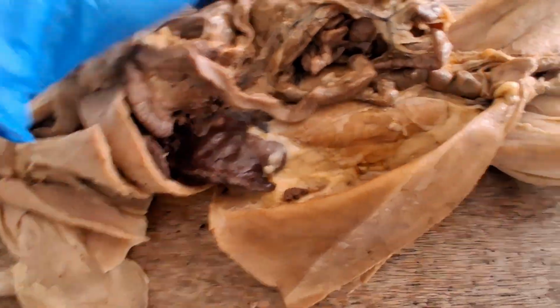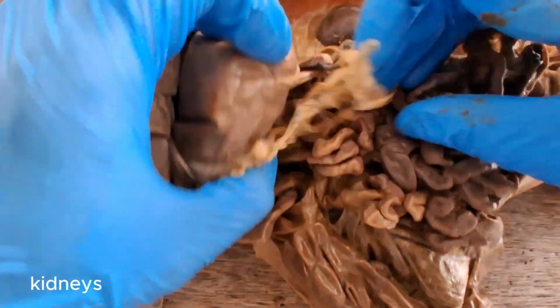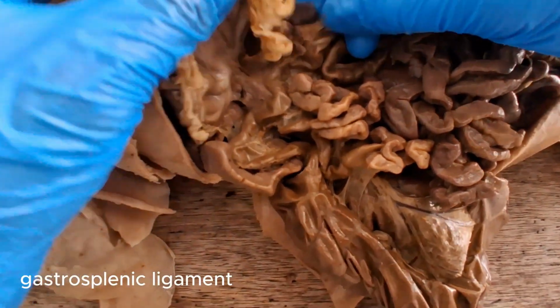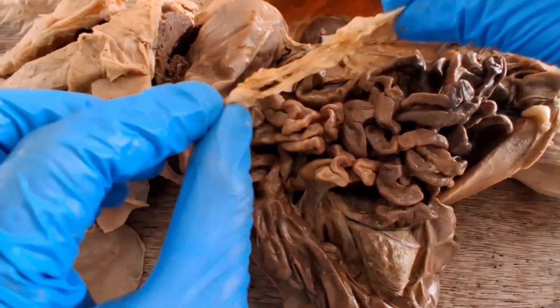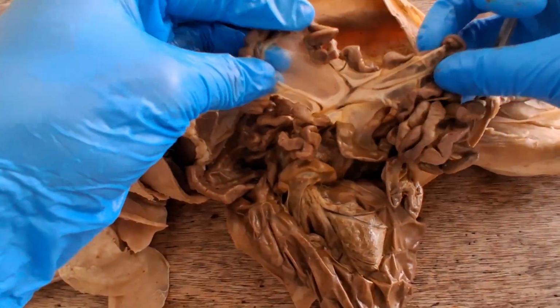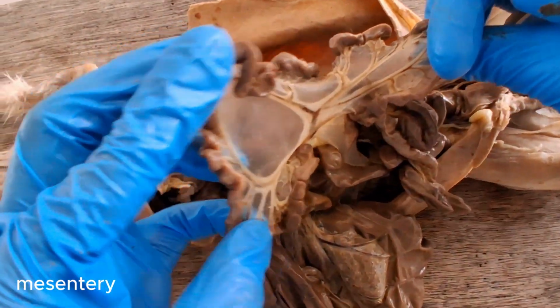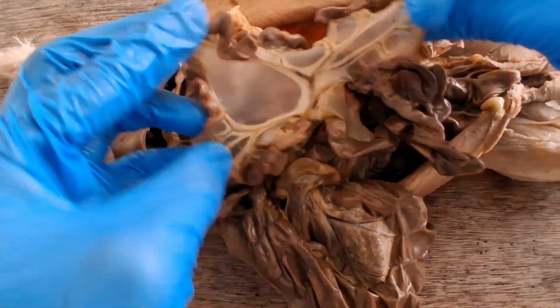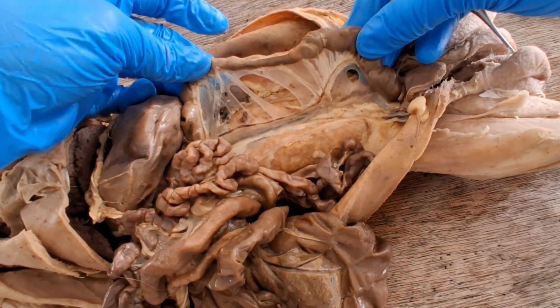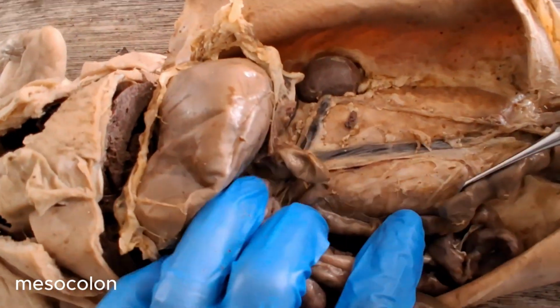This one is the right kidney. That's the left kidney. This mesentery in between the spleen and the stomach is the gastrosplenic ligament. This one is the greater omentum. This one supporting the jejunum would be the mesentery proper. Lots of blood vessels for the absorption of those nutrients. And if you look into the descending colon, there's also mesentery. That's the mesocolon. It's a postcaval vein.